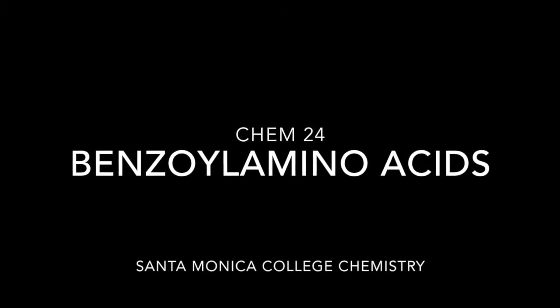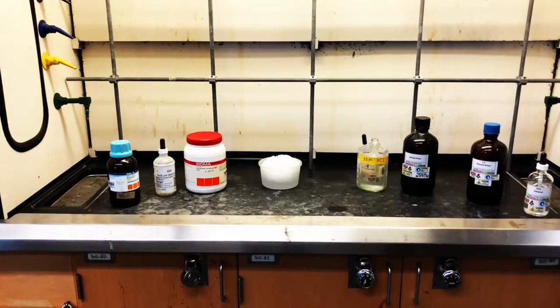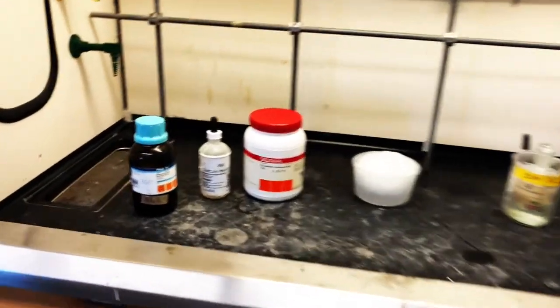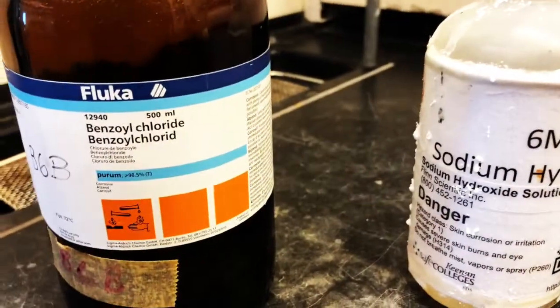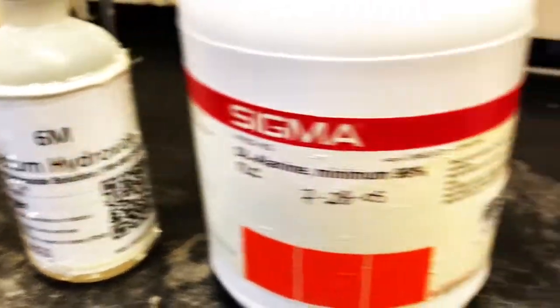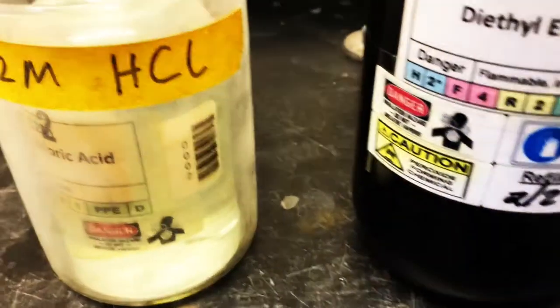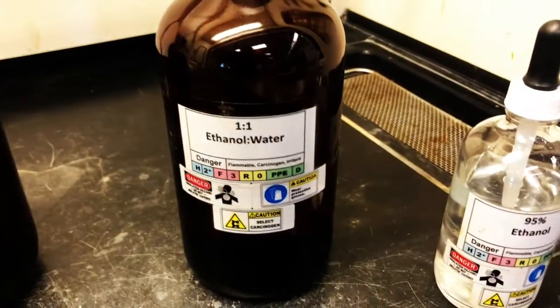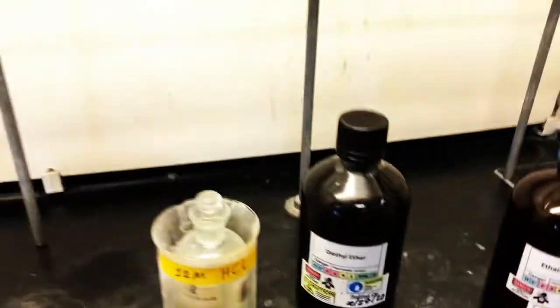Welcome to Chem 24 Lab, the synthesis of benzoyl amino acids. First, we'll take a look at the chemicals used. Start with benzoyl chloride on the left. Next to that, sodium hydroxide, 6 molar. Racemic DL-alanine. We have an ice bath, 12 molar HCl, diethyl ether, and our recrystallization solvents, ethanol water 1:1 and 95% ethanol.